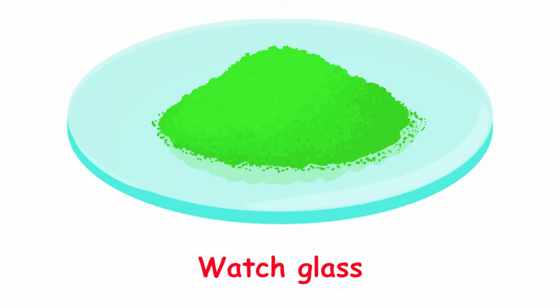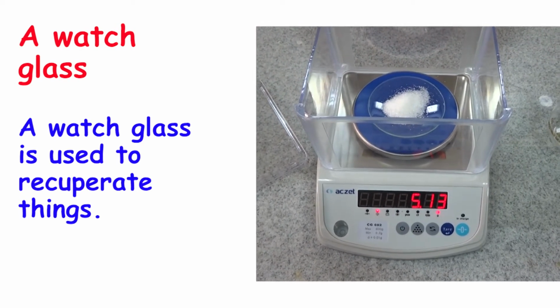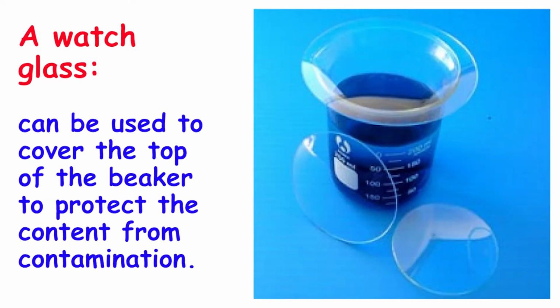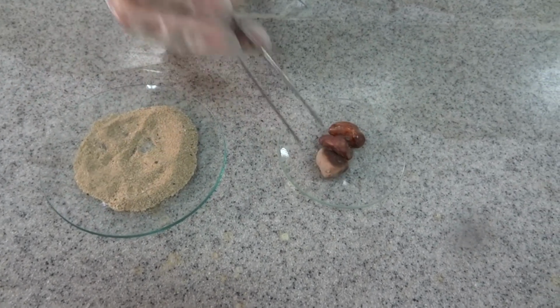A watch glass. A watch glass is used to recuperate things. It can be used to hold a chemical on the balance to weigh its mass, and it can be used to cover the top of a beaker. In this example, the watch glass is used to recuperate the small rocks.